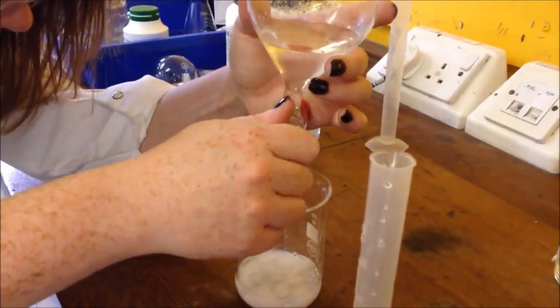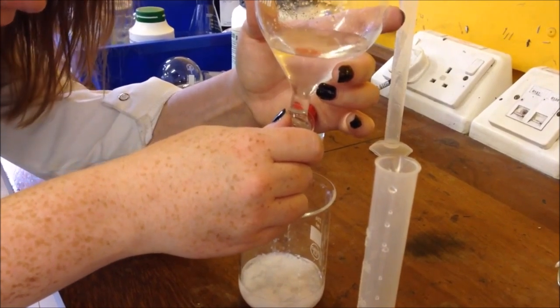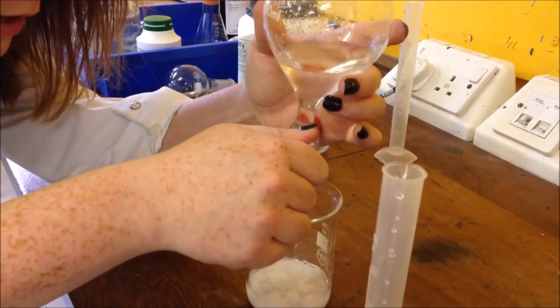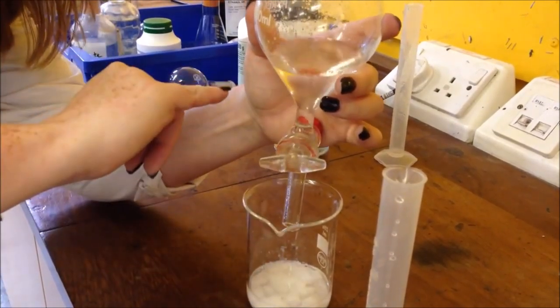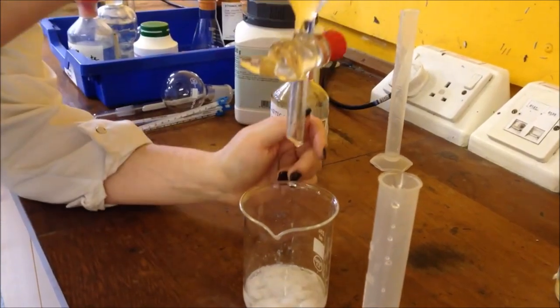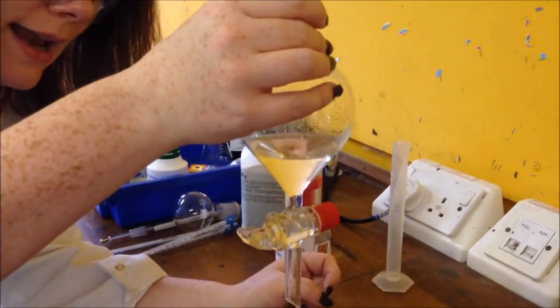Okay so it goes quite quickly once you take the top off. I'm just going to let it settle out for a little bit. And then go very slowly, drop by drop, watching the part between the layers separate out through. And then here I just have my top layer left.